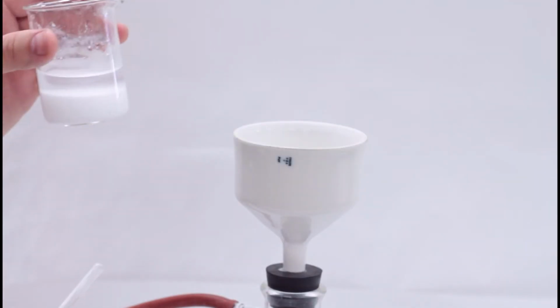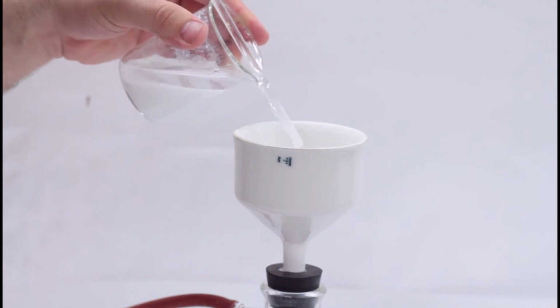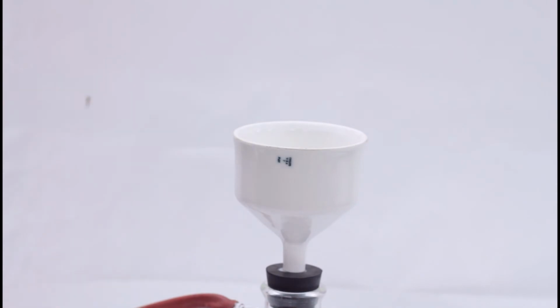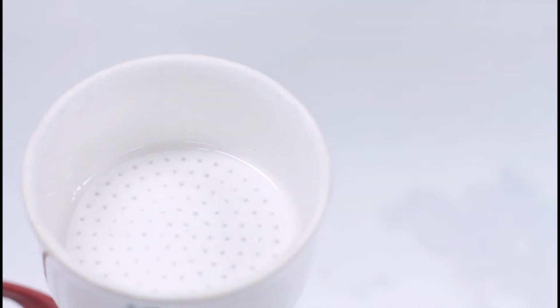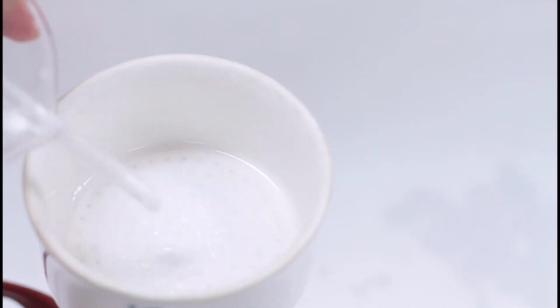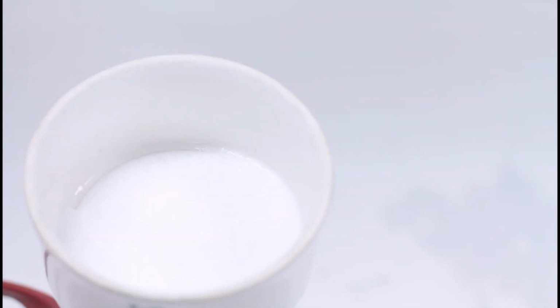Once the filter is ready and is fully adhered to the Buchner funnel, begin pouring the precipitate into the funnel. Use a glass stir rod to direct the water towards the middle of the filter. Try to go as slow as you can to keep all of the solid pooled in the middle of the filter. If you fail to do that, it is salvageable, but your accuracy will suffer. You'll be able to see the water get pulled away from the solid.